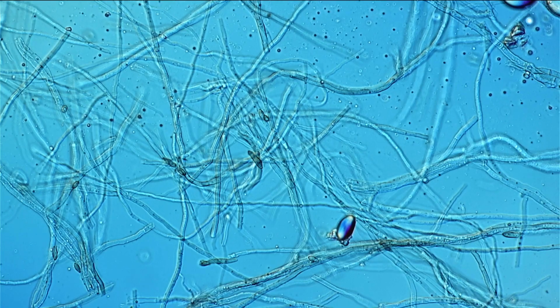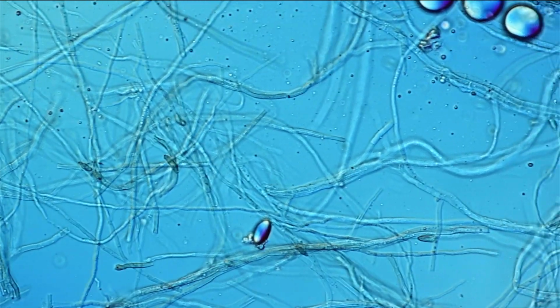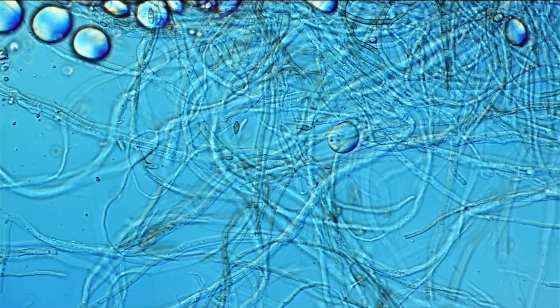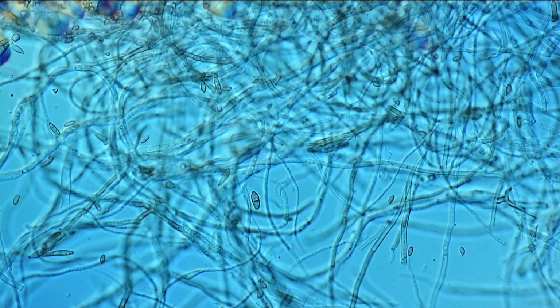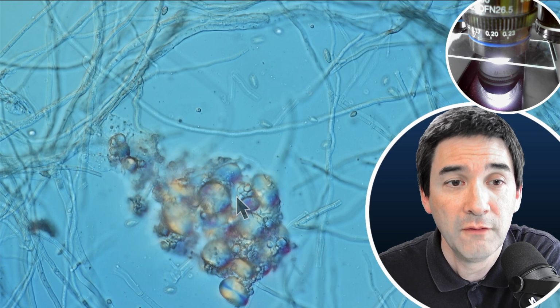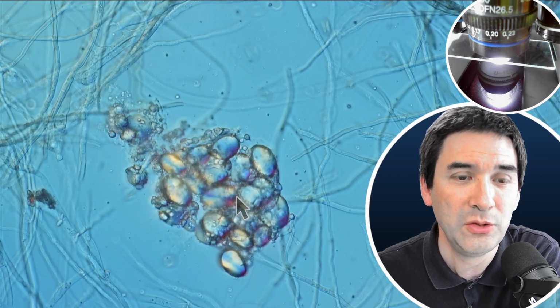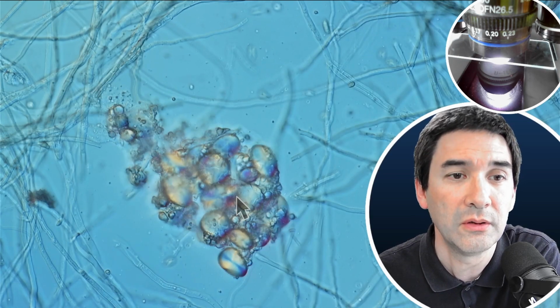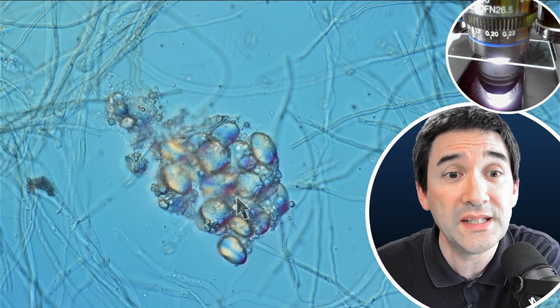Okay, so this is a little bit of an interesting specimen because I still did not identify yet what those round structures are, because in the past when I've seen spores, usually they're scattered throughout the whole specimen and not just clustered around one specific area. So I guess further studies have to be done because, honestly, I have to be honest with you, they do look a little bit like starch grains. Seriously, those clusters here look very much like starch grains, and I wonder if this could not be something a little bit from the bread itself.